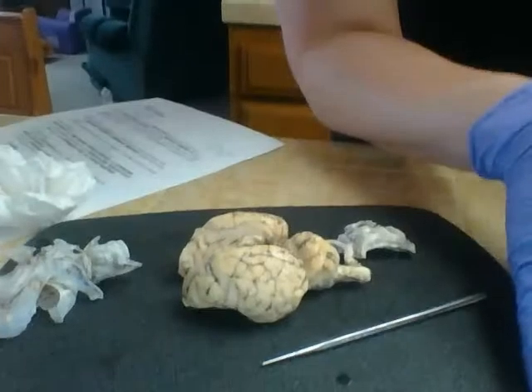Hi, I'm Stephanie Rutherford, and I am going to be recording the rest of the sheep brain dissection. So the brain has already been dissected for a previous lab report, but I'm going to try to piece it back together and go back through and point out some of the major sections of the brain and cranial nerves and so on. So let's extend this down.